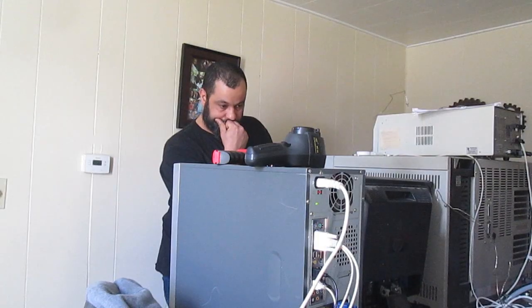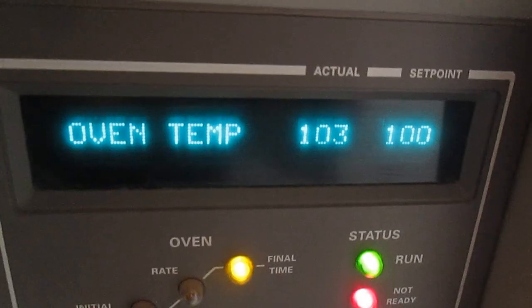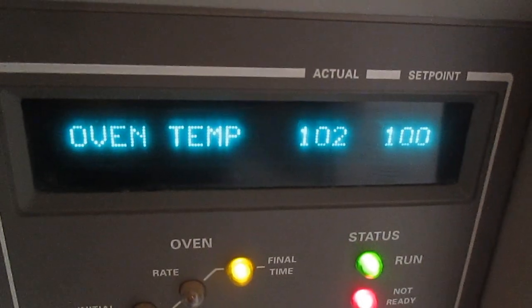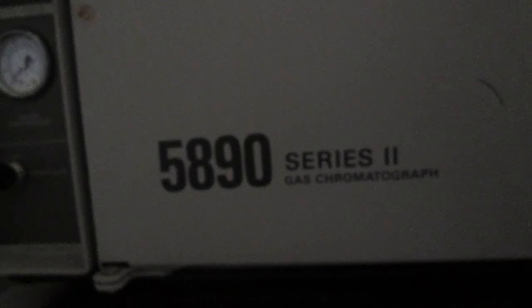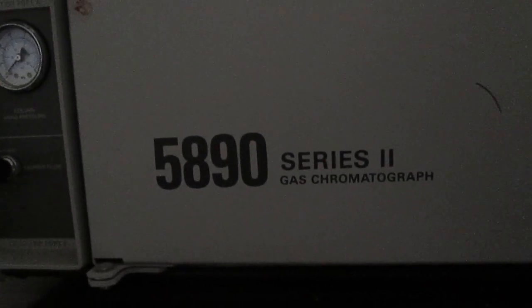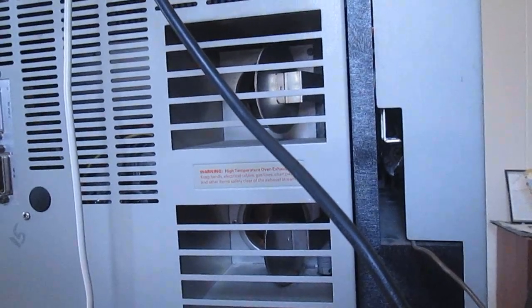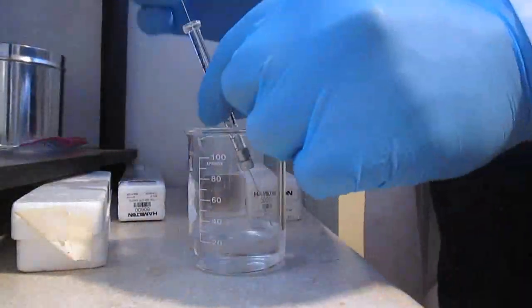Hello and welcome. For the last few days in quarantine, I've been messing with this old HP 5890 gas chromatograph and I'd like to share some of my work and analysis with you here.